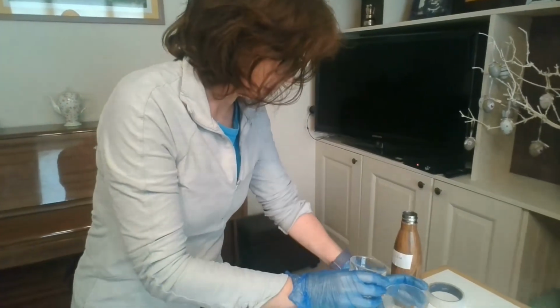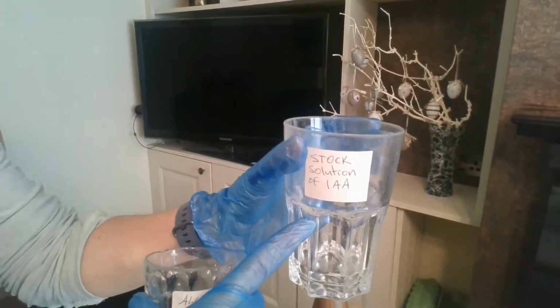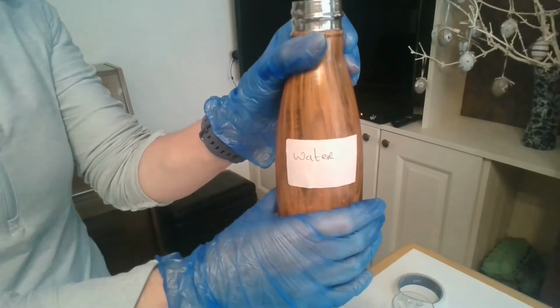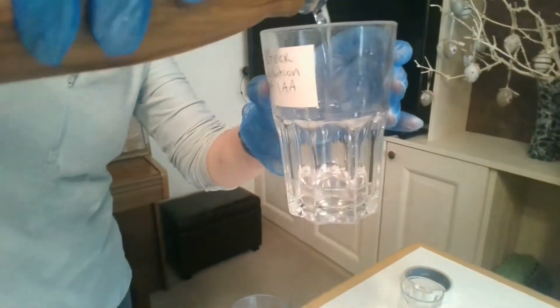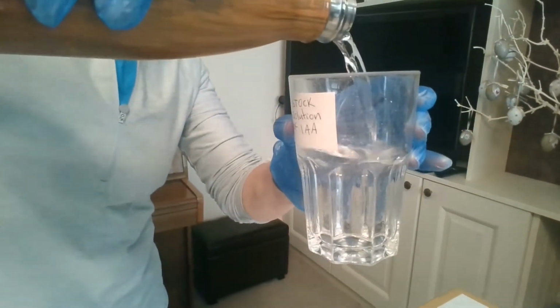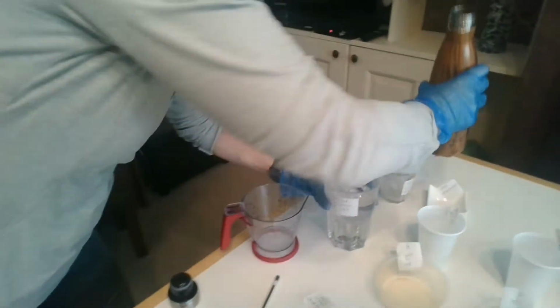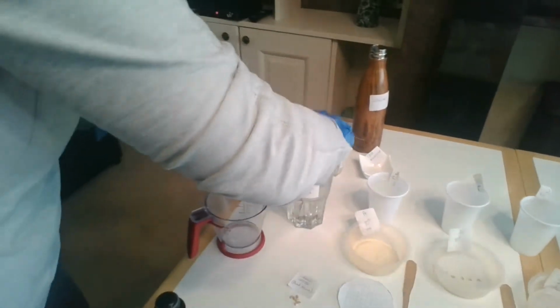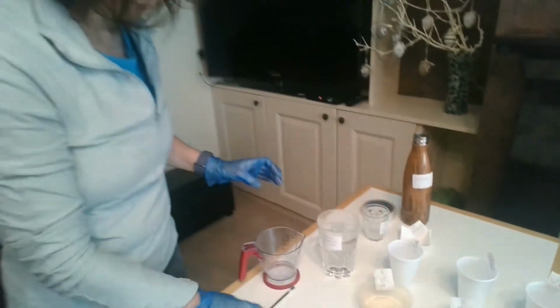When it has dissolved, I'm going to add it to a graduated cylinder. This is a graduated cylinder, and I'm going to make up a stock solution. So I add my IAA to my graduated cylinder, and I'm going to make it up with distilled water, and we use distilled water so we know that it's pure and there's no other possible chemicals in it. And I make it up very carefully to 1 litre, looking at the meniscus and looking at the graduation marks. So just go with me on this one. Again, I would give that a little stir to make sure that the concentration is the same throughout my stock solution.